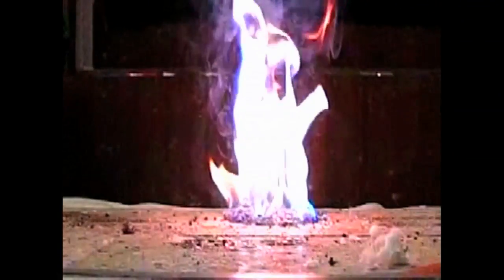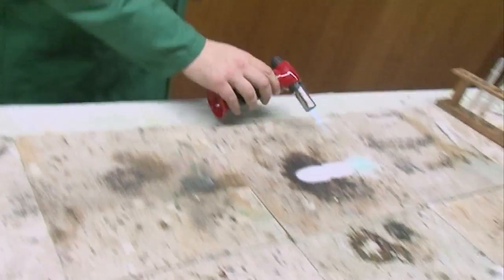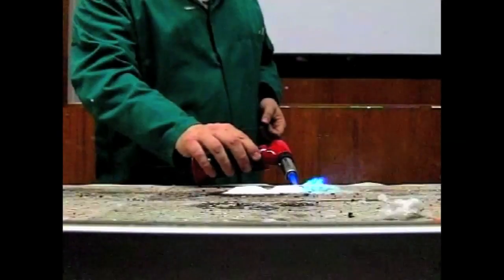So I'm going to make a series of mixtures which I'm going to place along the bench - that's the copper, strontium, barium. So let's see what happens if we do all three. That copper burns so fast! So a periodic video is tricolore - that copper burns so fast.